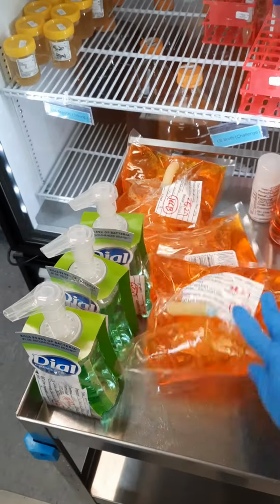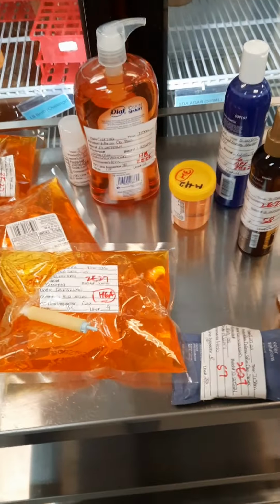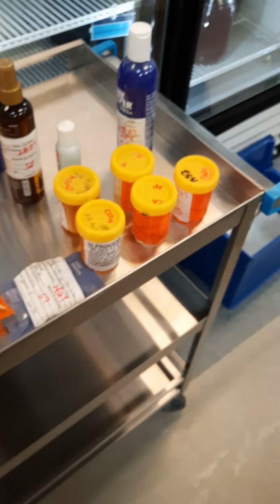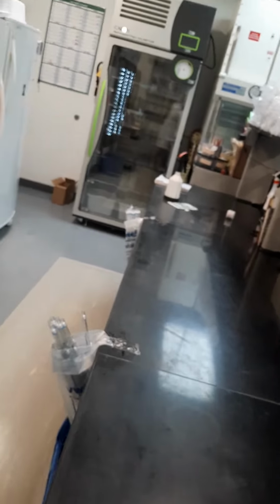So we test everything for raw materials, such as products you will find at the stores. And then we get these in-process materials or samples. And then there's some raw material samples that we have to test to see how the preservative efficacy is for finished product, and the sterility or cleanliness of the facility as it produces the finished product over here. But back to the main test that we technically do, the technical work, hence the title of technical microbiologist.